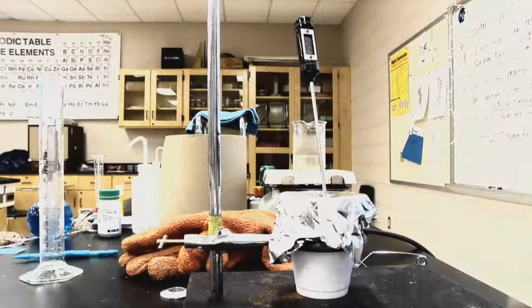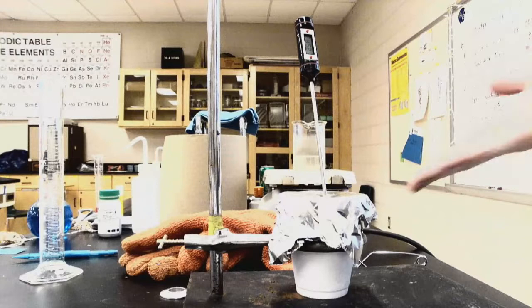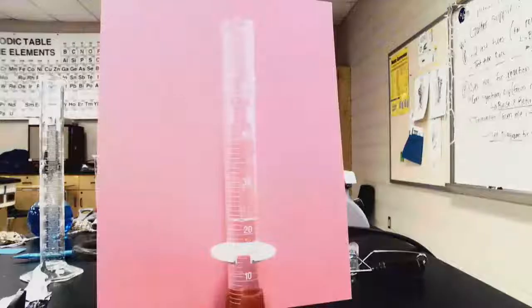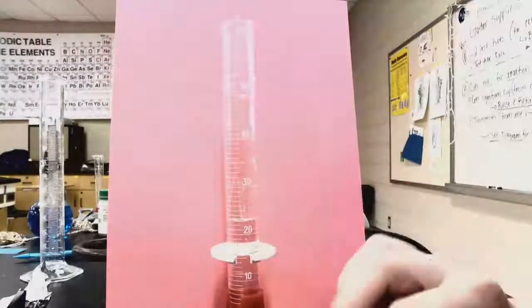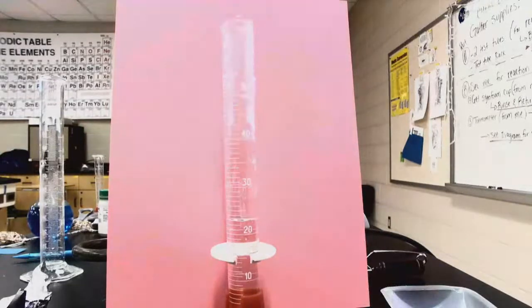So I'm going to go ahead and get a graduated cylinder ready really quick. I'm going to use a 25 milliliter one. I'm going to put some water in it, and then I'm going to get my metal out of my calorimeter and determine the volume of that metal really quickly. So I did not have a 25 milliliter cylinder, but instead I found this 50 milliliter cylinder. Our original water line is right here, so I'm going to let you go ahead and take your best guess as to what you think that measurement will be. I'm going to upload a picture of it as well.